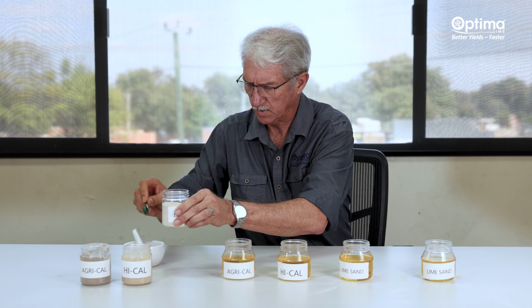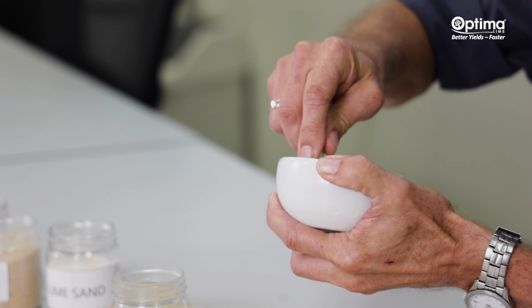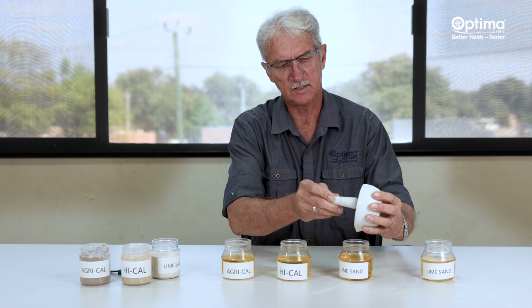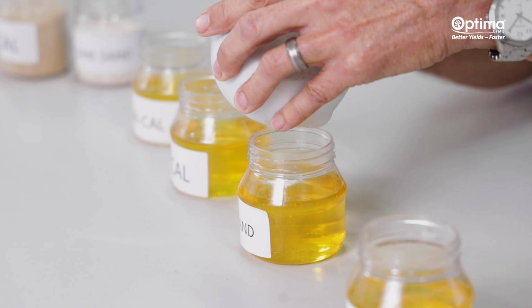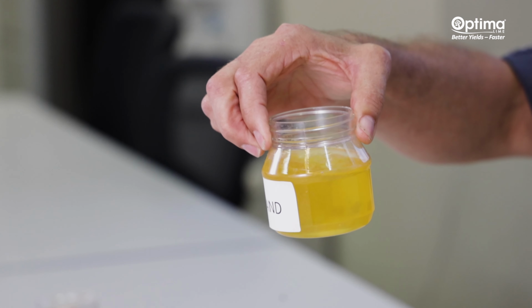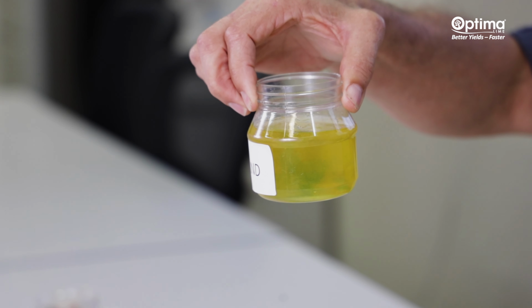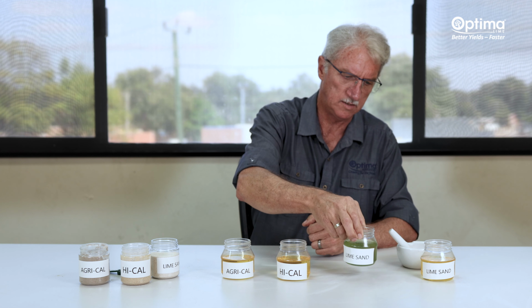When you put 1 gram in a mortar and pestle and crush it very finely down to the same fine size that they do in the lab when they do the reactivity testing, and you put that same amount, 1 gram of lime sand that's finely crushed, back into the reactivity liquid, you will see that it's going to be a totally different story, and pretty soon you're going to get a different reaction again. The fineness definitely changed the reaction of the lime sand. Takes a bit of time, but there it comes. And when it starts to react with that fine particle, it will change the pH.